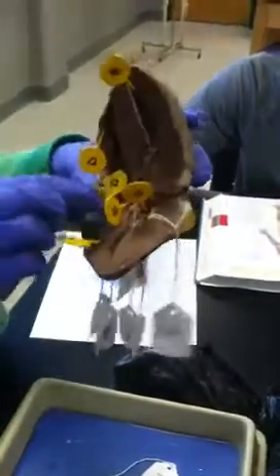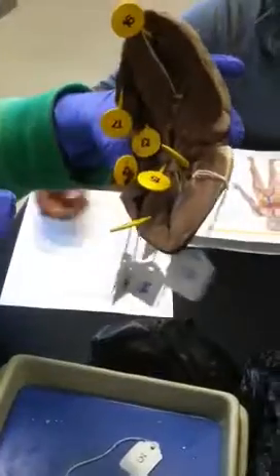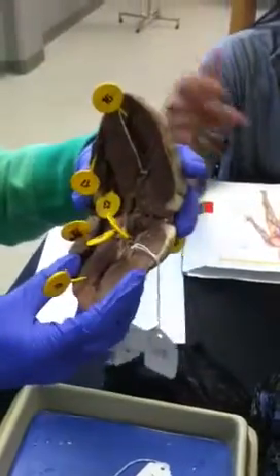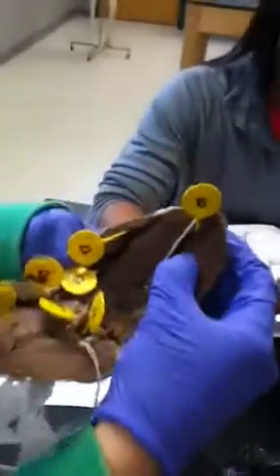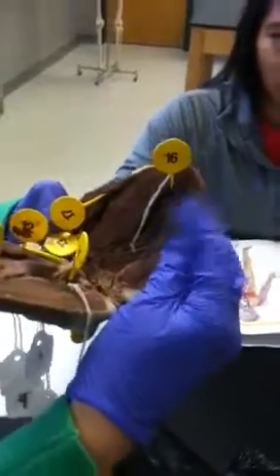And then 15 is the aortic semilunar valve, which serves the same purpose as the pulmonary valve, except it goes up to the aorta instead. It guards the entrance. And then the trabeculae carneae, which is number 16, is all this stuff inside the internal walls of the ventricular chambers, and they're just irregular ridges of muscle.